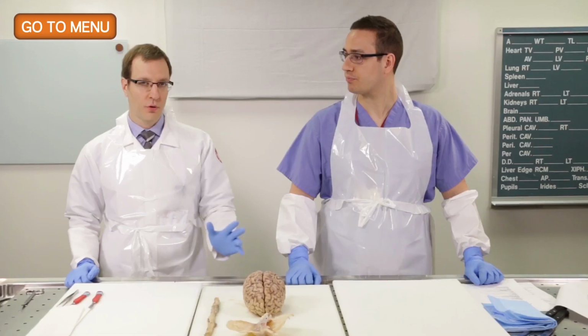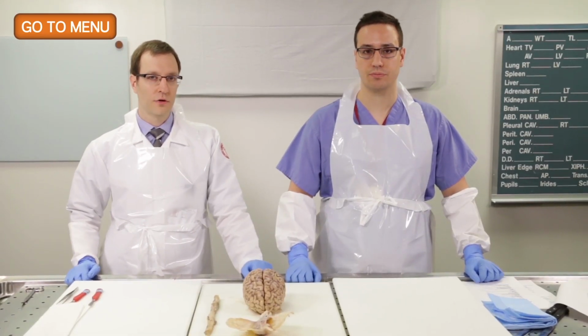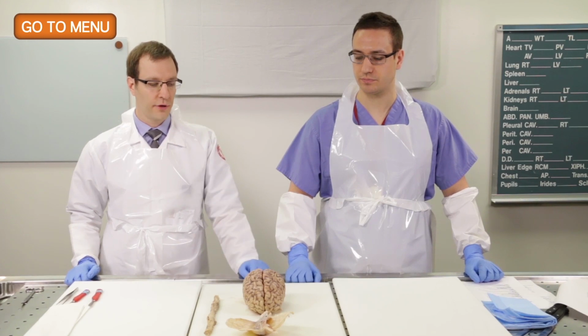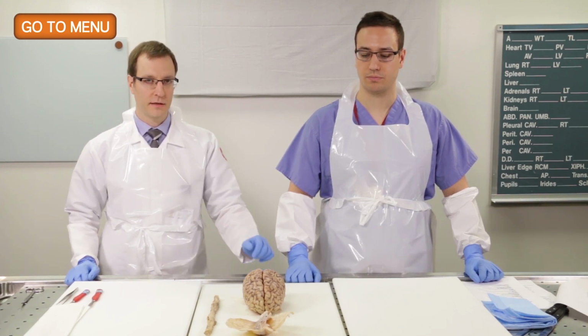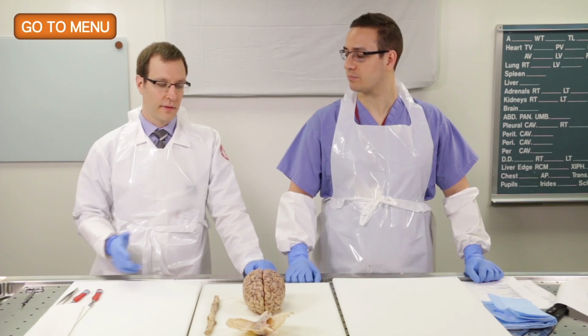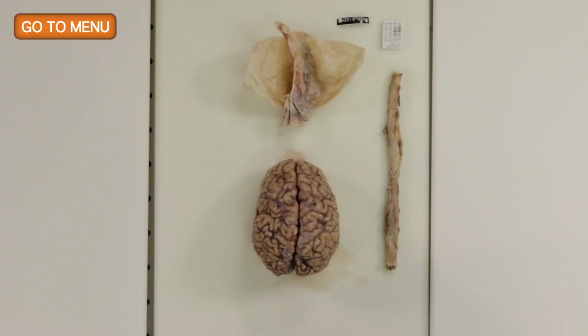Okay. So it's always important, if there is neuroimaging available, to review that prior to brain cutting. So we can target our analysis if there are smaller lesions that are detected on imaging that we would then want to find in the gross specimen. With weakness on the right side, where would you be looking for a lesion in the brain? Typically, we'd be looking for a lesion on the left side of the brain.